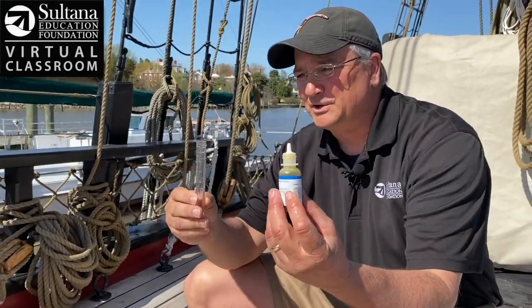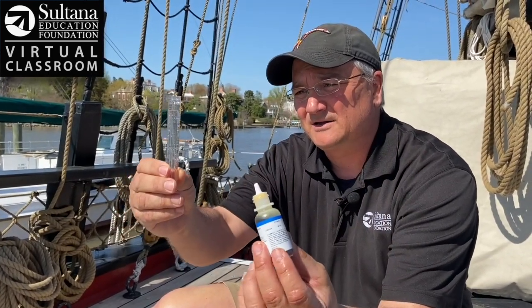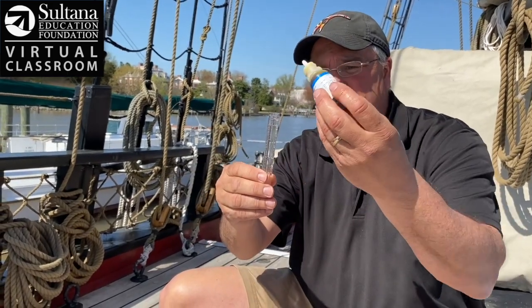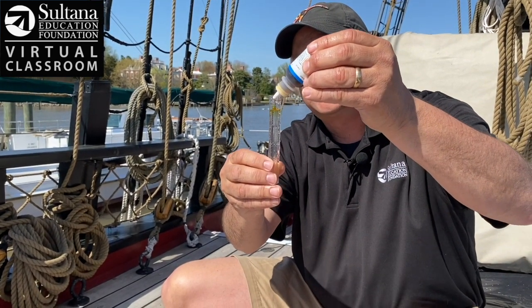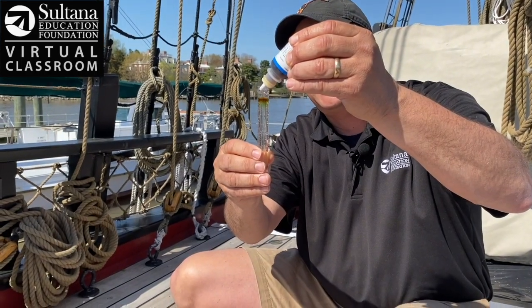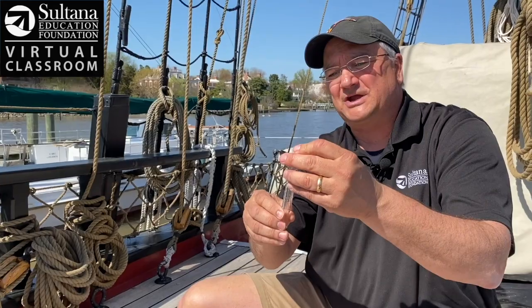To do this, I'm going to put 10 drops of this reagent into my water sample. The reagent will bond with hydrogen ions and turn the water a different color. Let's count 10 drops together: one, two, three, four, five, six, seven, eight, nine, ten. I put the cap on and shake vigorously — back and forth for about a minute.